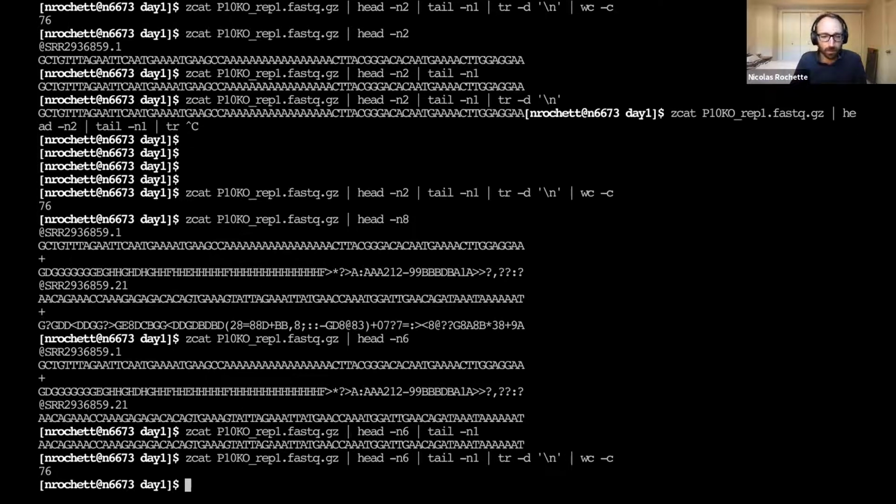And if we wanted to do a histogram of all the sequences, we could do other, more complex commands. We're not very far away from that. But yeah, we could do it as well. It's just slightly more complicated.